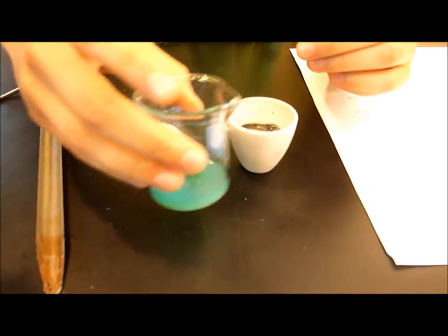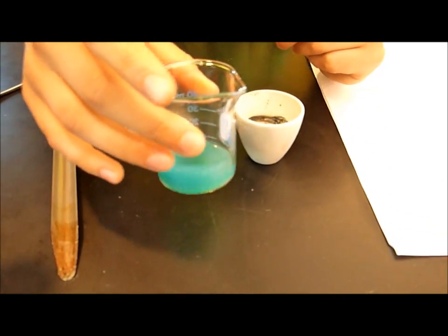Gently swirl the beaker to completely dissolve the solid. Note the color change of the solution is green, as the copper ions are rehydrated.